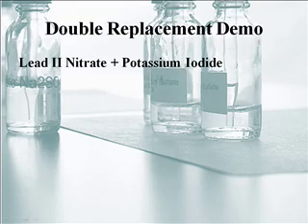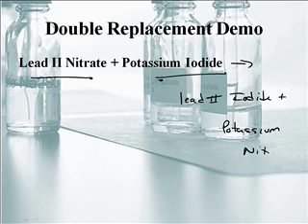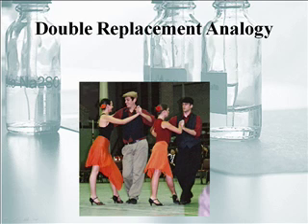There you go, Mr. Sams. That was cool. So this is the reaction: lead(II) nitrate plus potassium iodide formed lead(II) iodide and potassium nitrate. Do we like to write it like this? No, we usually like to write the symbols. We'll teach you how to put all the symbols together in another podcast. This is just so you can identify which type is which.